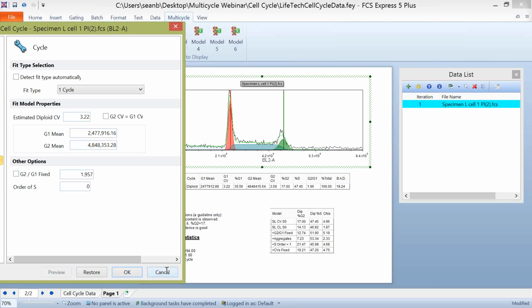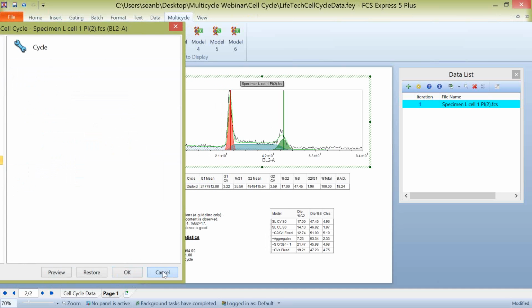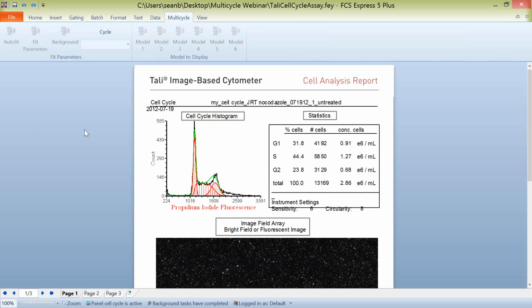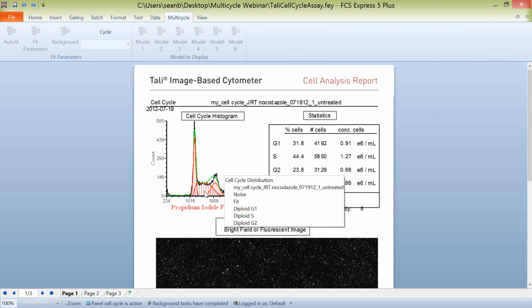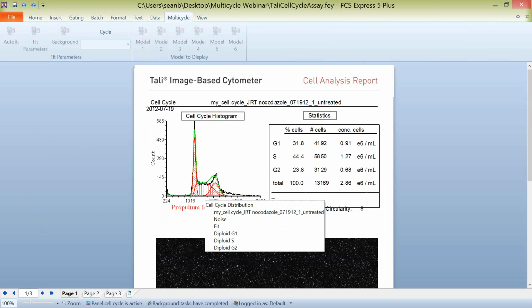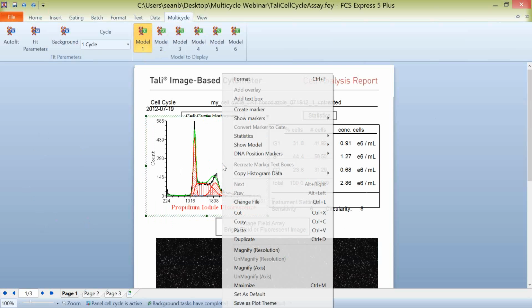Our 4N populations are twice as much as our 2N populations. But you may run into cases where this value needs to be changed and you need to use the fixed value. So you check this box and you would manually type in a value. So what I'll do is I'll show you some data where this has actually occurred and where it actually makes some sort of sense to change that value. In this case, we're looking at some image cytometry data, and you can clearly see there's a G1 peak, an S phase, and a G2, and we fitted that data correctly.